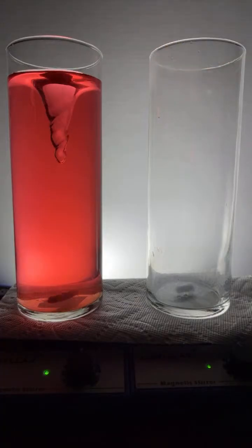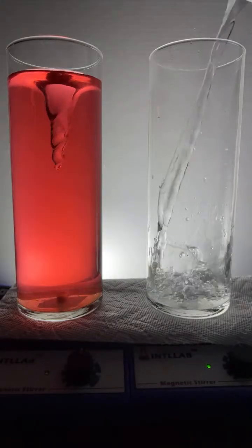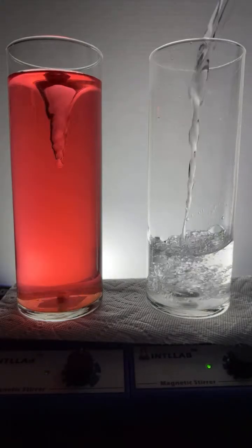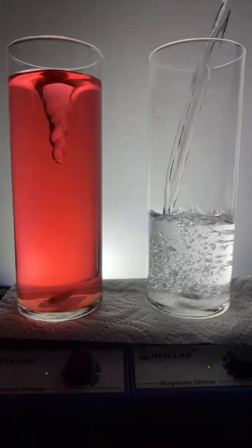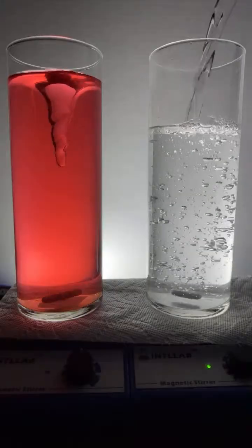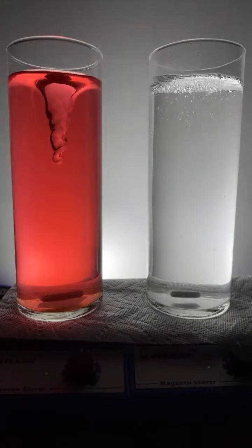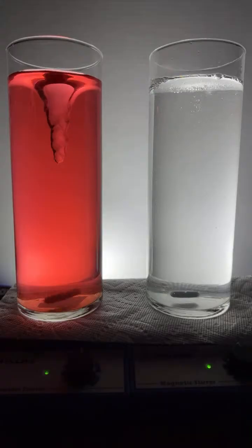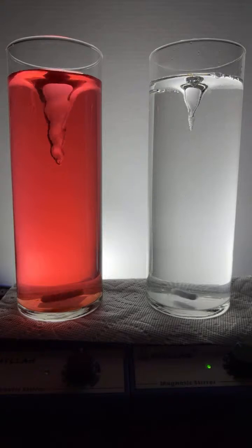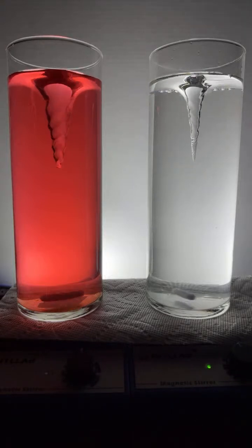Let's get this flask filled with some water. Over here on the right, we got the one on the left already filled. I'm adding distilled water. They are both on magnetic stir plates. The flask on the left has some universal indicator added. I need to add some universal indicator to this one over here on the right for sure. Let me get to that.